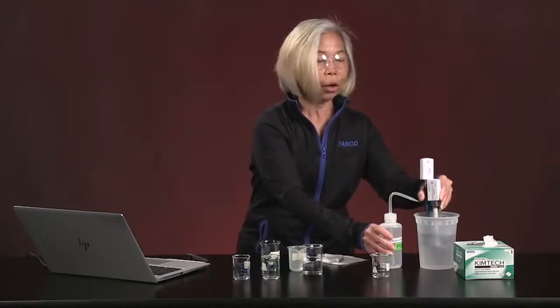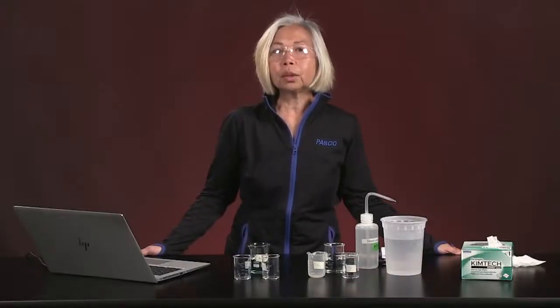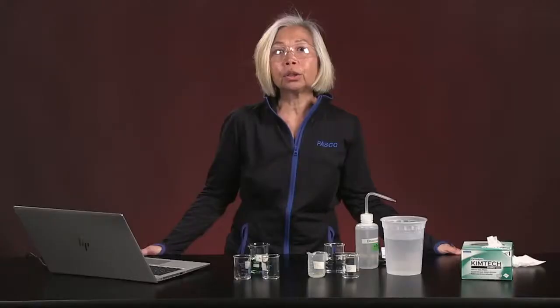In the next section, we're going to talk about what all this means and how we analyze this data. To analyze your data, I first would like to ask you to look at the data you just collected from this lab. Look at all the parameters for each of the individual solutions, and then look what happened to those parameters when you mix them. So in your solutions, I want you to look at what AB and CD look like compared to the original solutions A and B and solutions C and D.